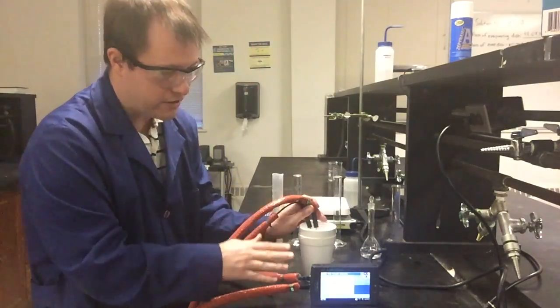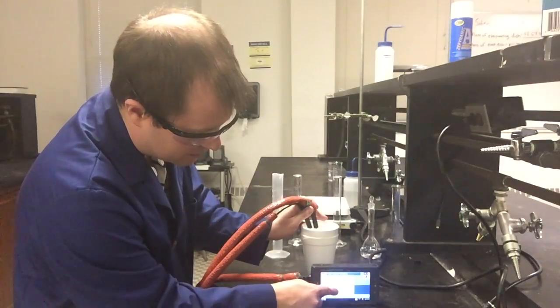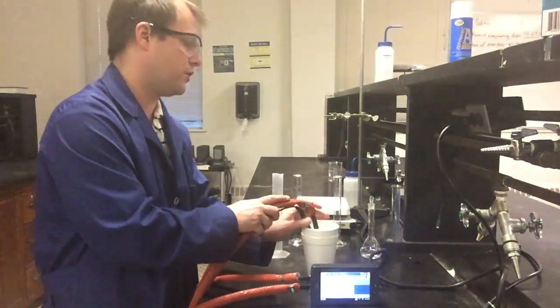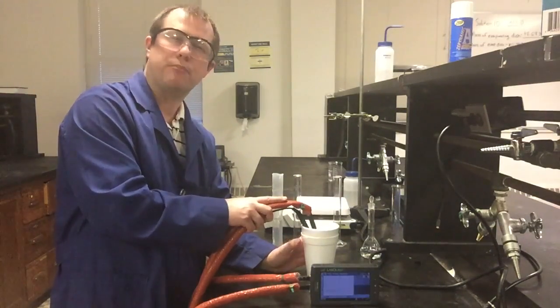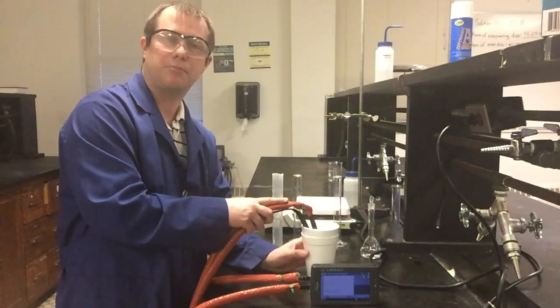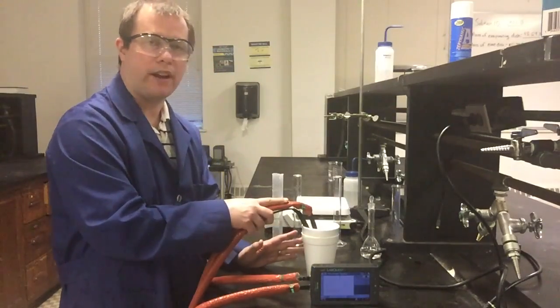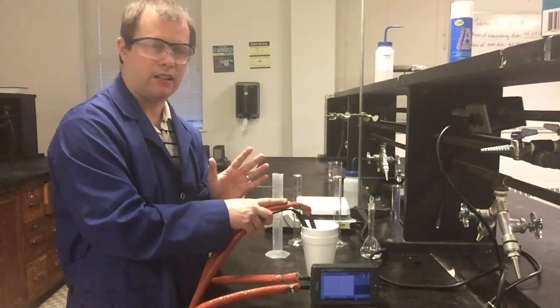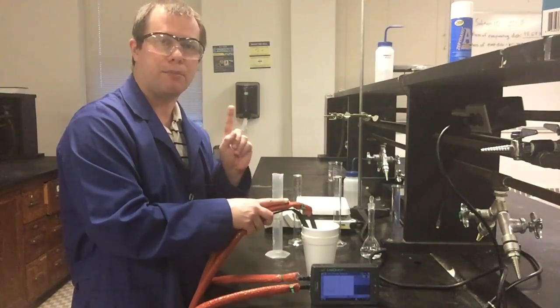And we should hopefully now see our temperature spike. In fact, if you see here, we have the two lines mixing together and everything shot up really high. So that's a good sign, right? We mix an acid and a base. We should know hopefully from some previous experience that it does get hot when that happens. It's what we're looking at in this experiment, the energy release that occurs in that reaction. One thing I'll point out, and I'll say this again when we look at the data later, the temperature of the water is going way up, but the water is going up because it's gaining the heat.